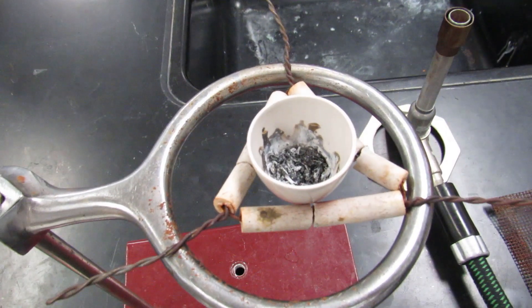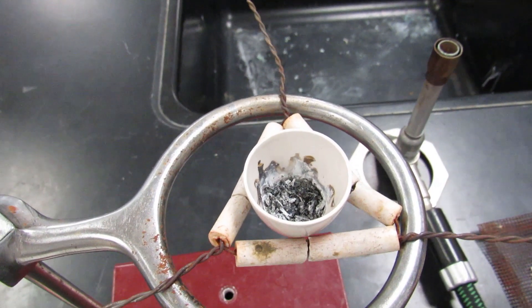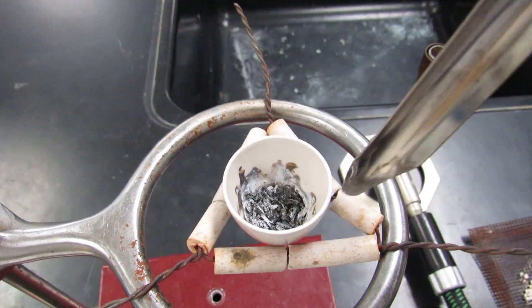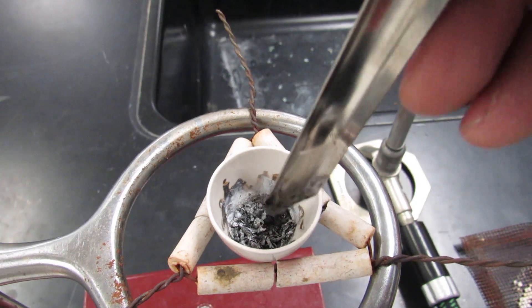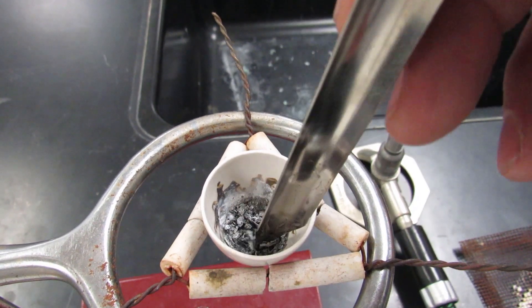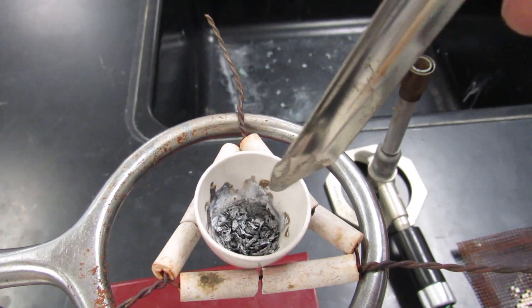I took the lid off here so you can see what it looks like inside after it's heated enough. You can see these tiny pieces. I'm going to poke at it a little bit. And all the pieces that are hard break into a little powder. That tells me that it's done the initial heating.